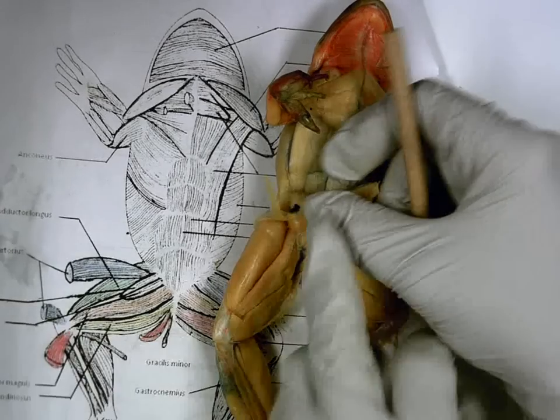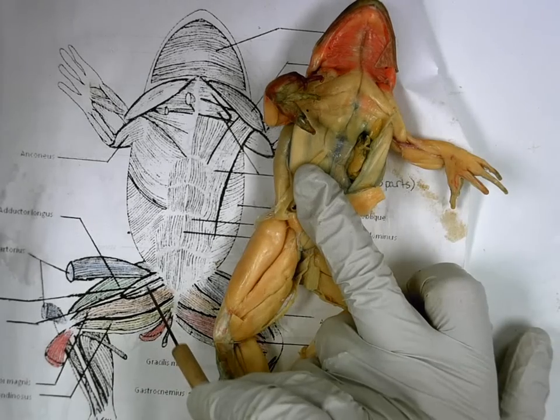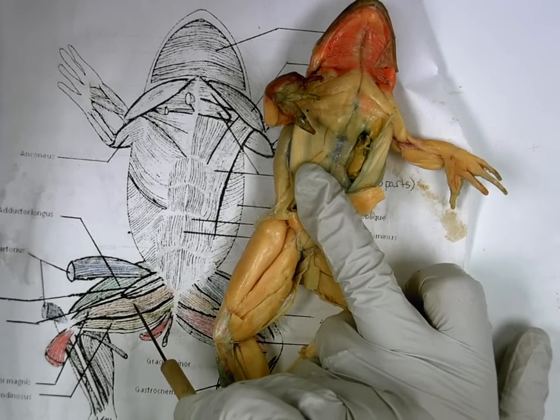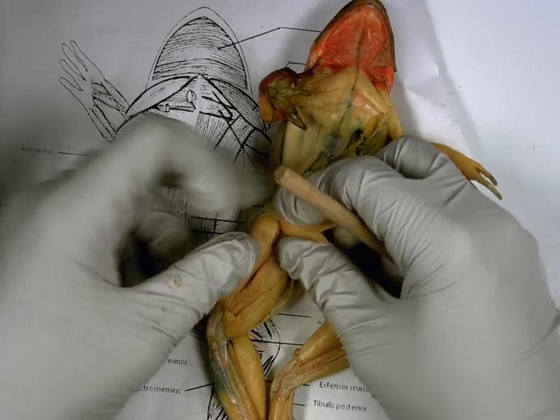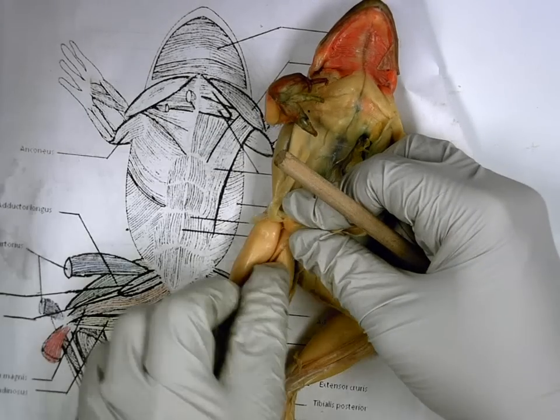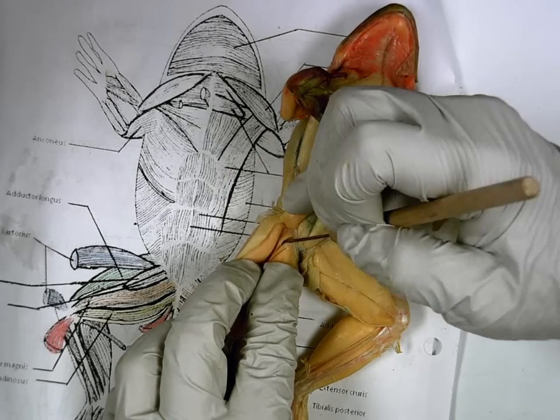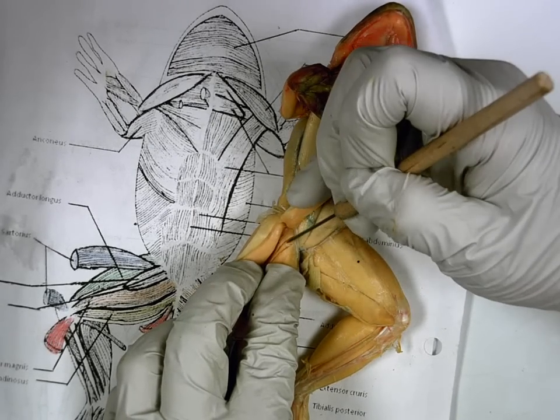Now, in our diagram here, you'll see there's two little triangular muscles in between adductor longus and adductor magnus. You have to pull apart these two big muscles. And theirs is very pretty. If you pull them apart, you can see I can just clearly separate this triangular one from that one.